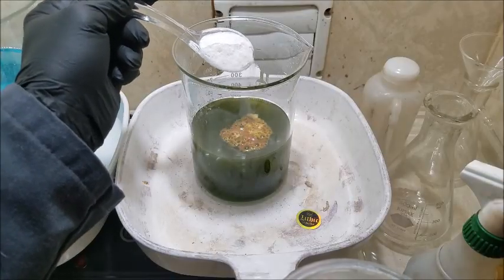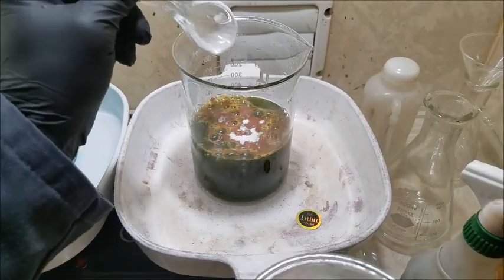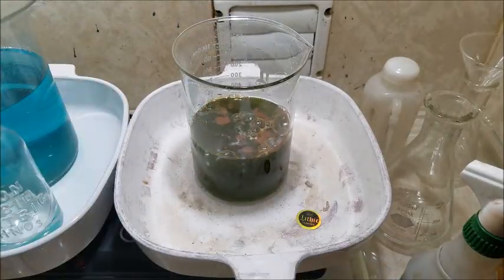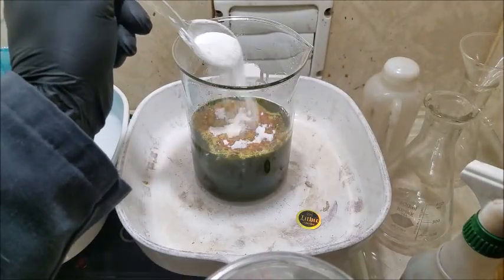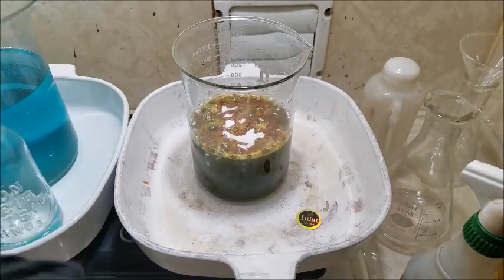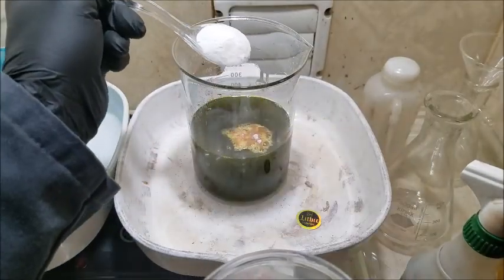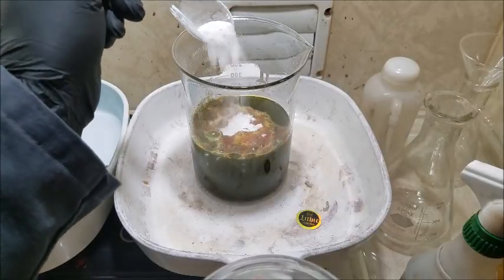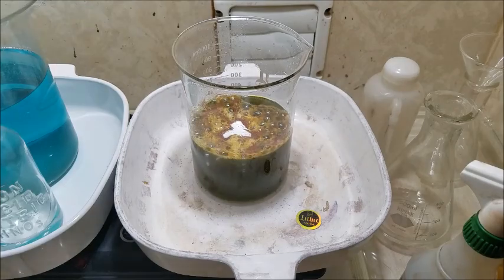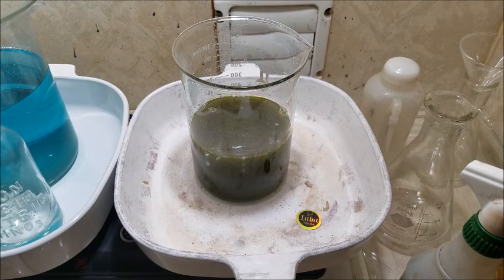It's not a pretty look. Matter of fact, I've never seen it look that color. Turn that brown like that. That's weird. It's definitely some nitric acid left in there. Still not getting the look that I'd like to see.